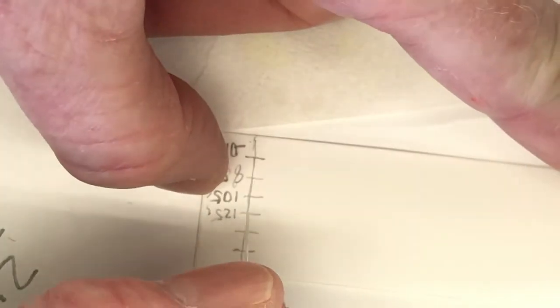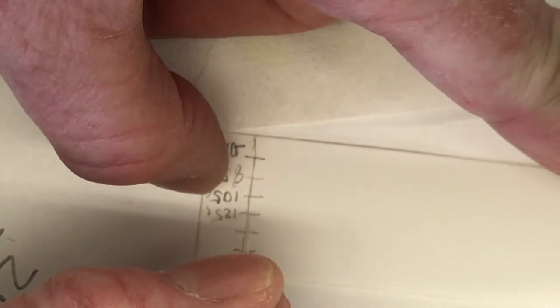So let me go into here. Drain, drain, drain, drain. And then I'm going to spot at 125. There, and that was at 5 minutes, 26 seconds.